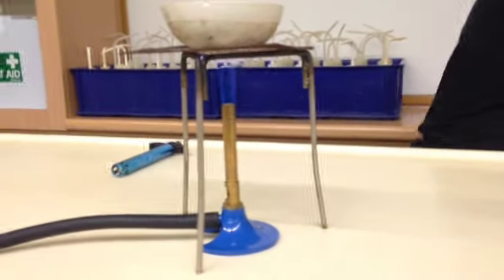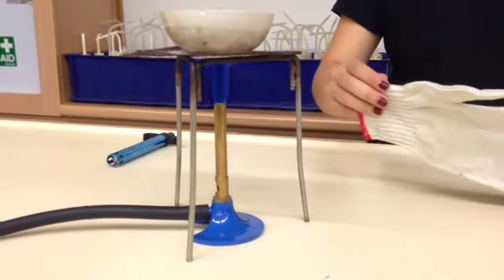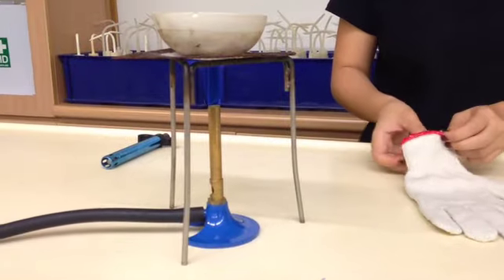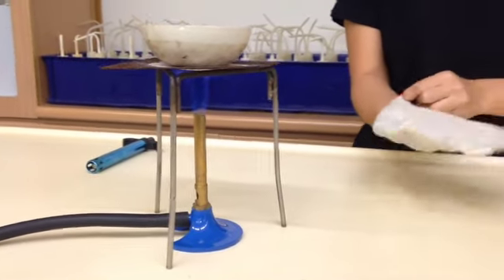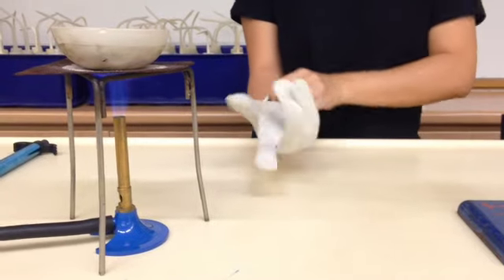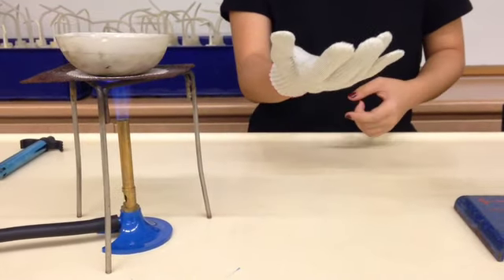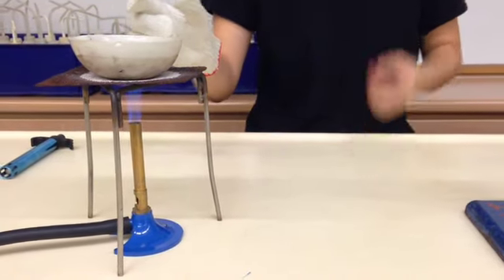While we're doing this, you are also given a glove. This glove is not for you to be Michael Jackson, but it's for you to be safe. Put on the glove and make sure that whenever you are handling your evaporating dish, you are wearing this glove because the evaporating dish is going to be very hot.